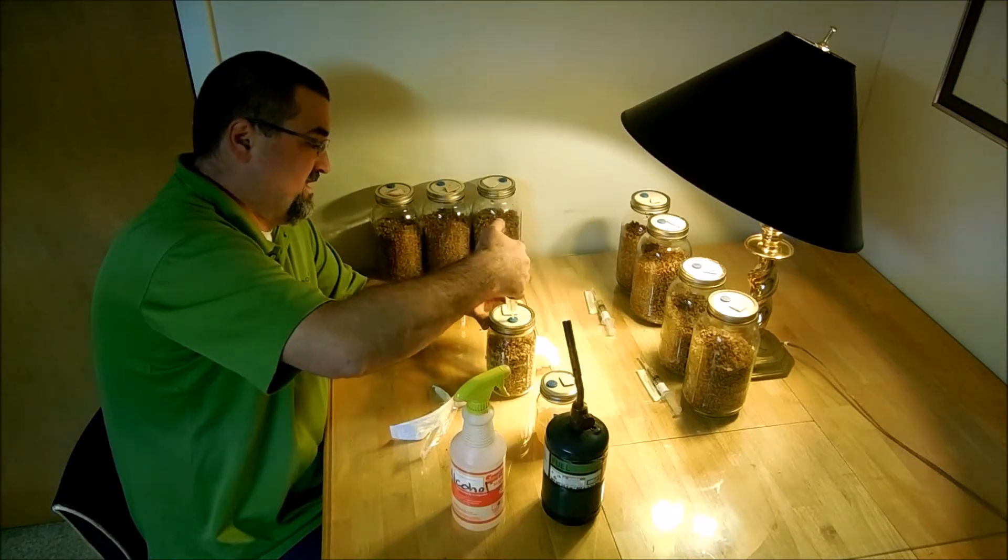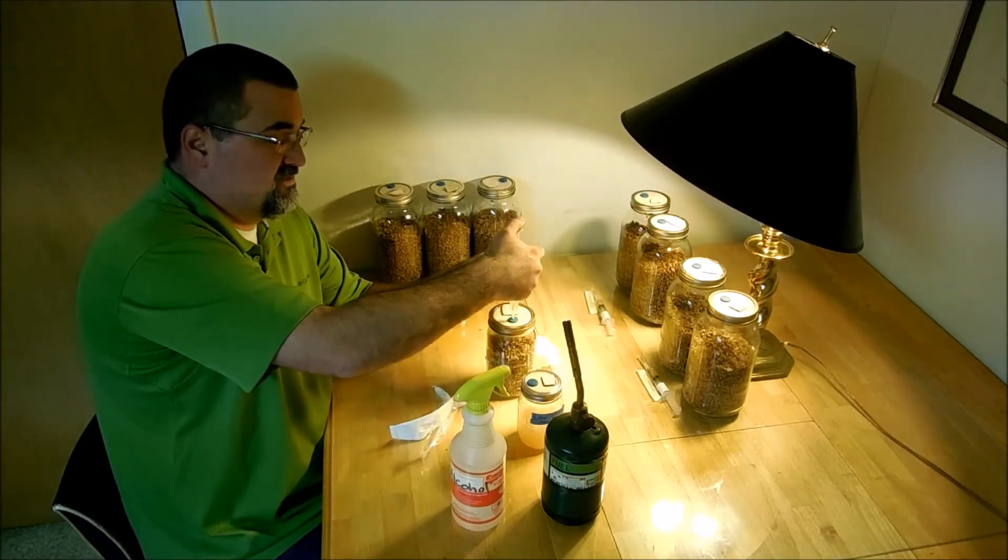Stick it in here and we'll get this guy. This is pretty fresh, so I'm going to give it four cc's.